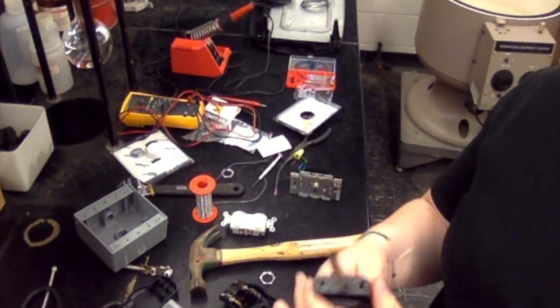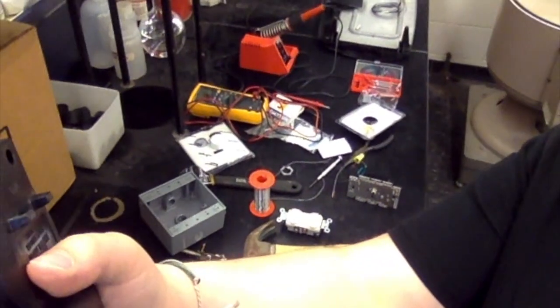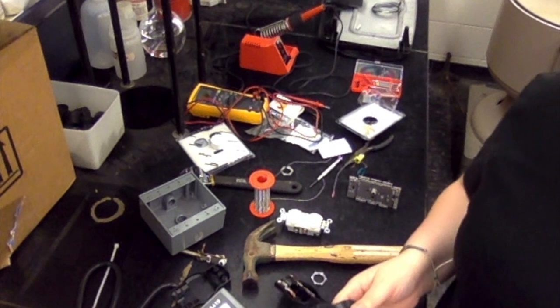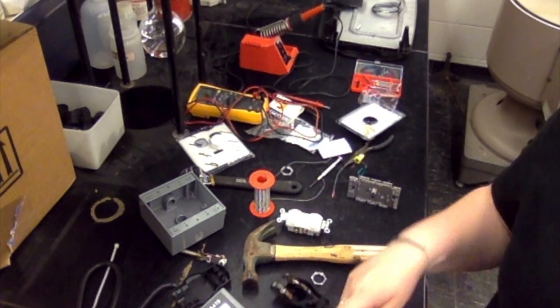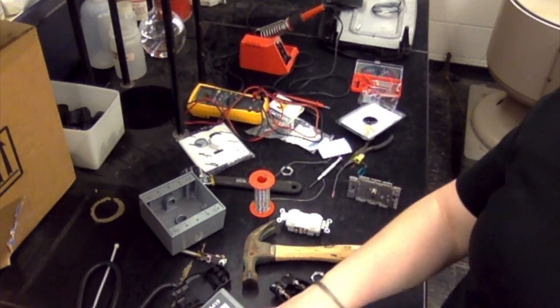Okay, this is a video to show how to do the griddle modifications used for mason jar diffusions. There's a pretty succinct description of how to do it in technical note 0201, but it can still be confusing just from that description, so we're going to make a video.